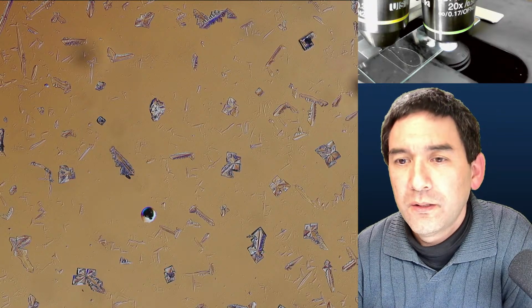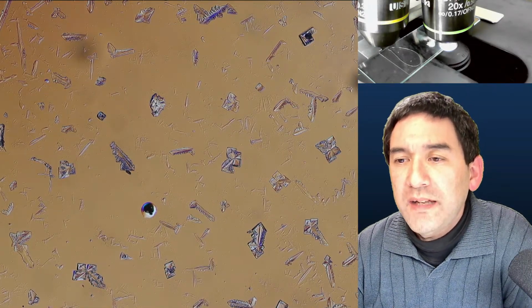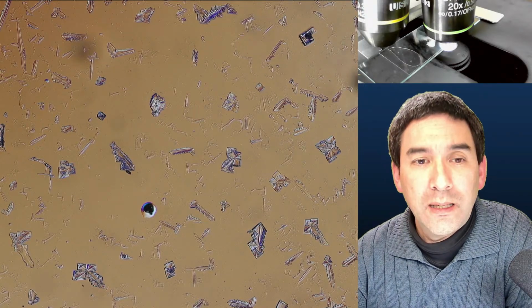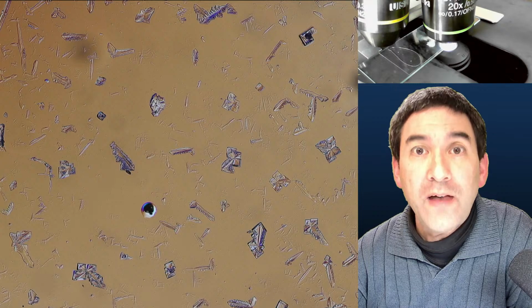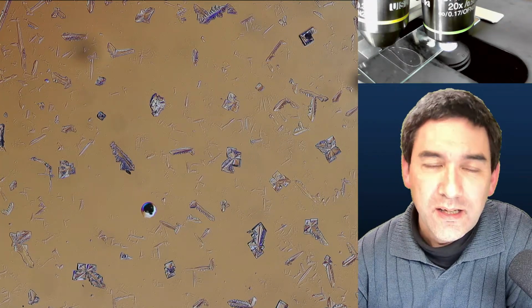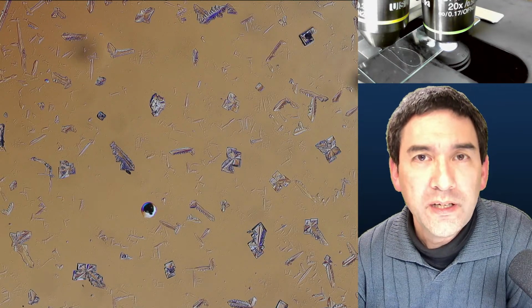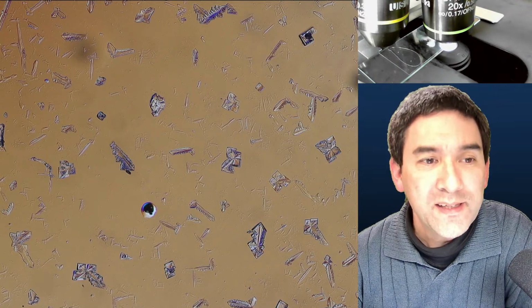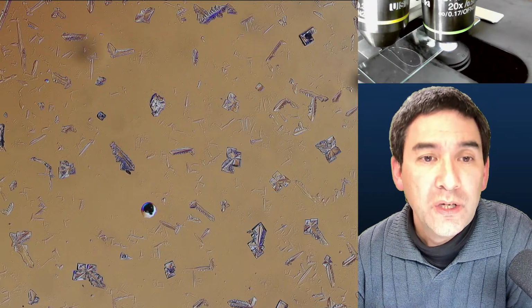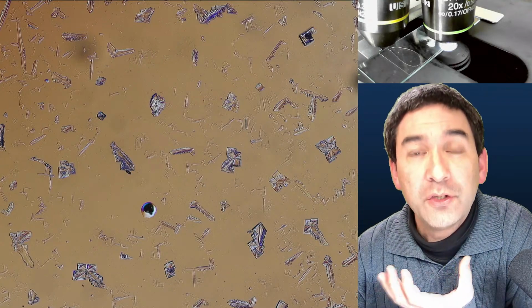So, sublimation will give instant fully grown crystals, or will they still grow as it cools? Well, the cooling is so fast, so basically I think yes and yes. I mean, the crystals have to grow, obviously, but the cooling and crystal formation is so fast that you can almost say it's instantaneous. So they're not going to grow now anymore because there is no substance around them that could crystallize.